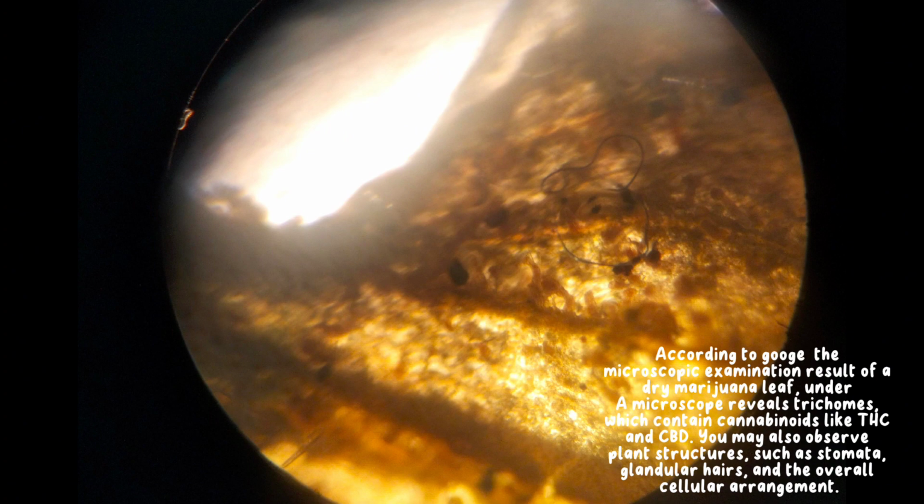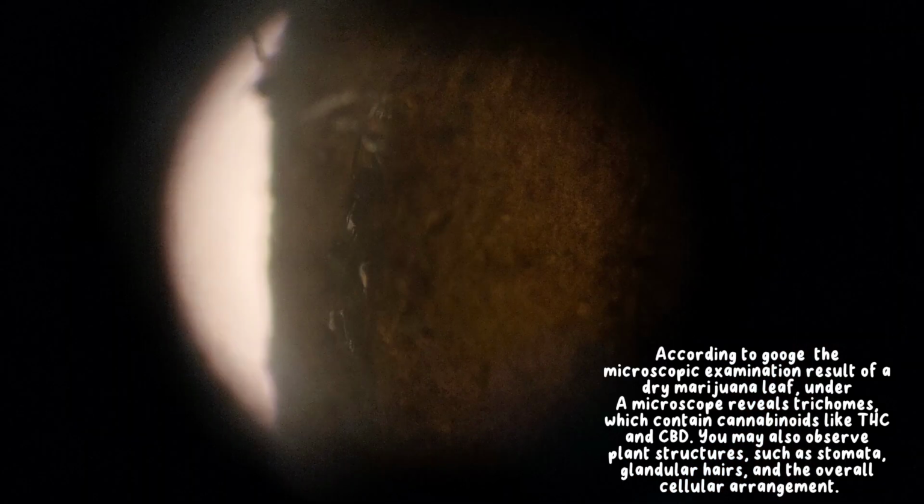According to Google, the microscopic examination result of a dry marijuana leaf under a microscope reveals trichomes, which contain cannabinoids like THC and CBD. You may also observe plant structures such as stomata, glandular hairs, and the overall cellular arrangement.